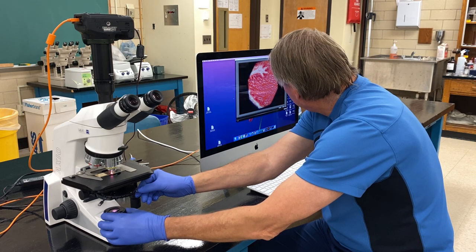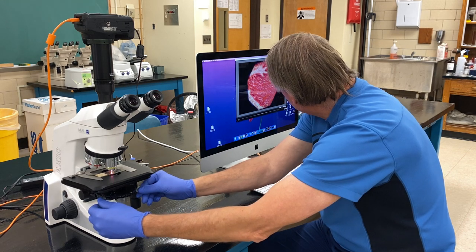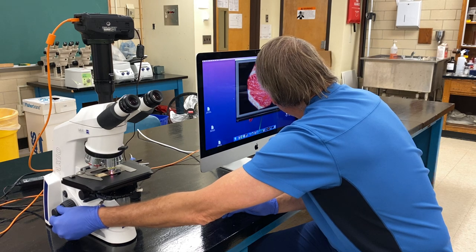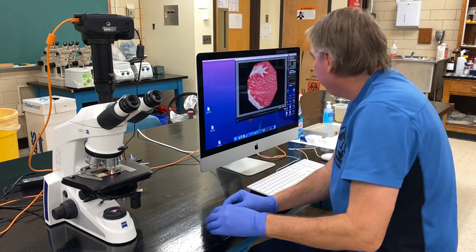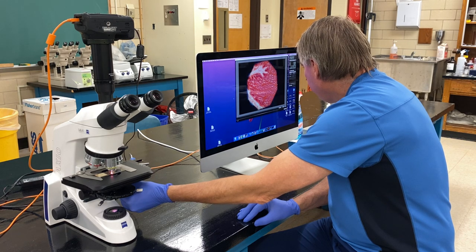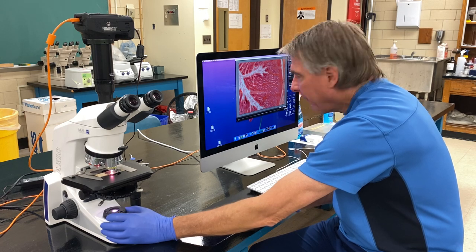Center the edges of the field diaphragm within the live view window to the best of your ability. Make sure the sample is perfectly in focus — this particular sample isn't sharp everywhere, but pick a spot and make it sharp. Then focus the condenser lens until the edges of the field diaphragm appear sharp. Once done, spread open the field diaphragm so the entire field of view is covered and you can see your image.